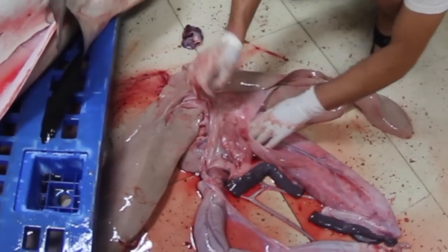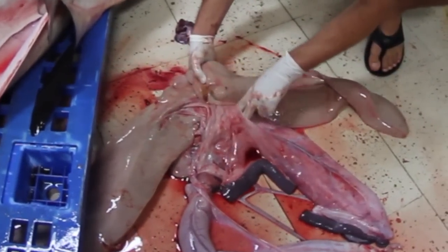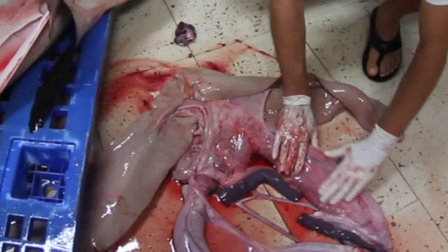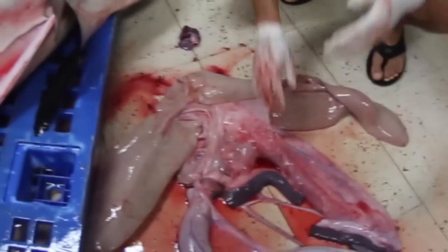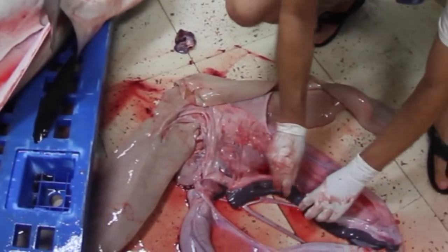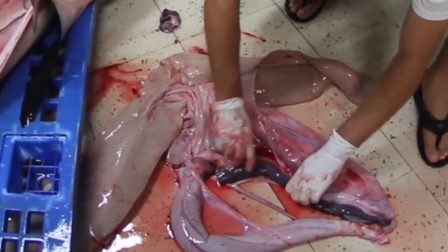This here is connected directly to the esophagus and it is the stomach. All this part that comes from here is the stomach — it looks like it is empty; these animals were not fed here. And this here is the spleen.